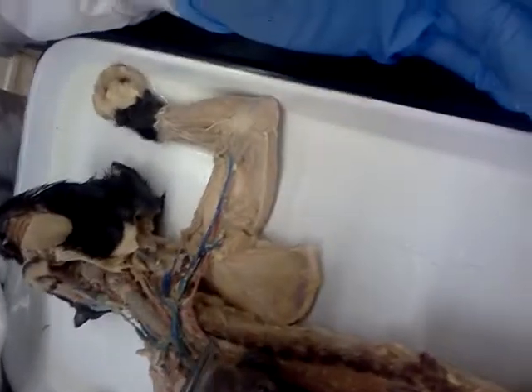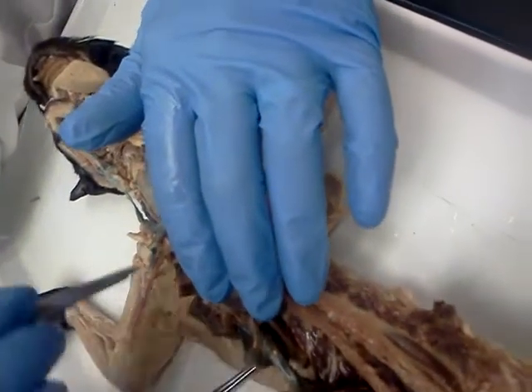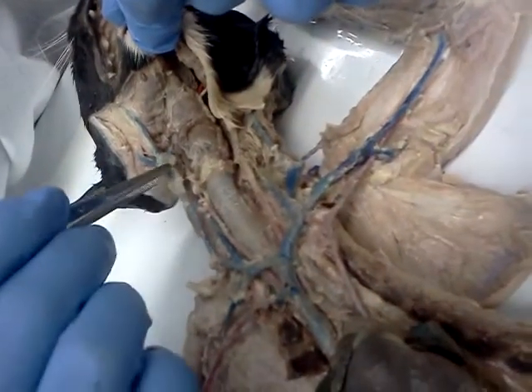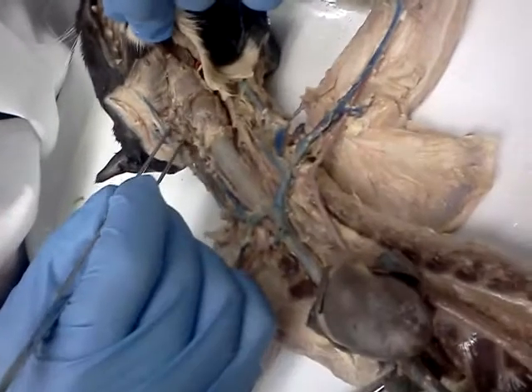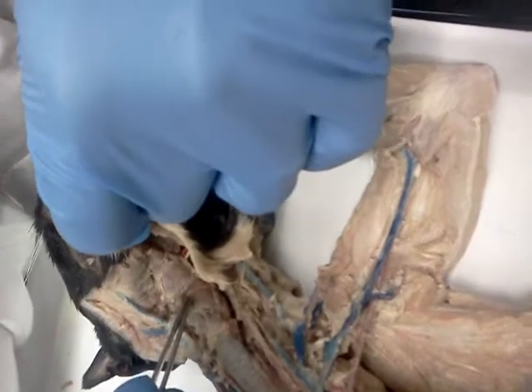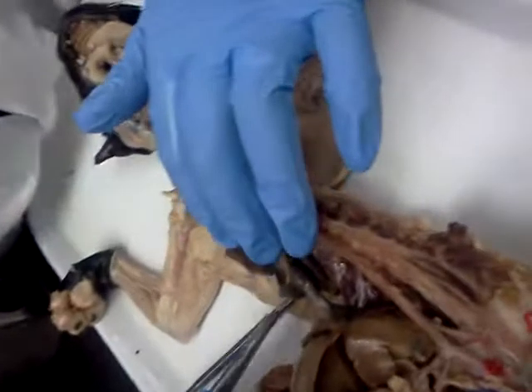So that's inferior to the axillary. The brachial, according to this diagram, is going to follow the axillary. Now, as we travel downwards, I forgot to point out that the external jugular splits in three directions. The posterior facial vein, anterior facial vein, and if I had been more careful and hadn't hacked it out, there would be a transverse facial vein, where this would go like that. It's been cut out because I wasn't cautious enough when I did this.